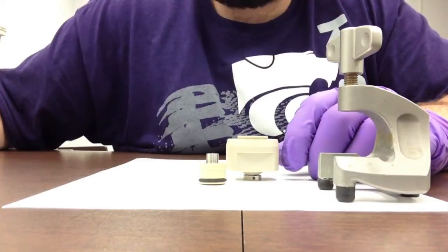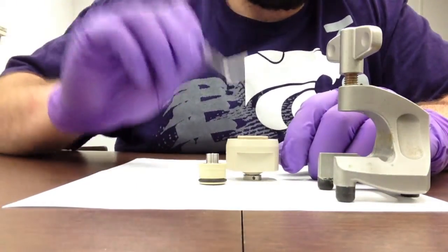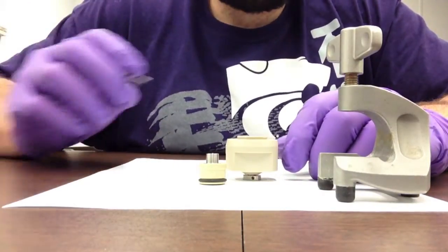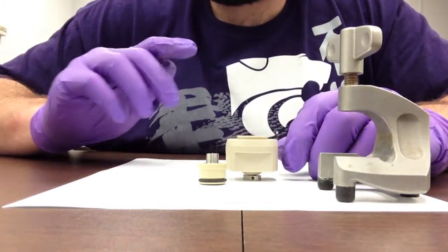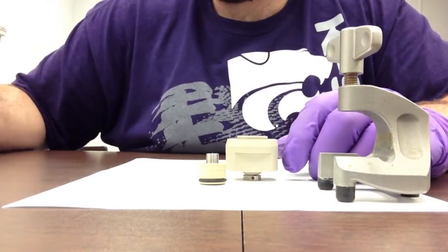After seating that into the ring, we place the fiberglass spacer that comes with the L-cell package, and on top of that we would place our lithium counter electrode, which being outside we would not do. So simulating that will be this piece of stainless steel.